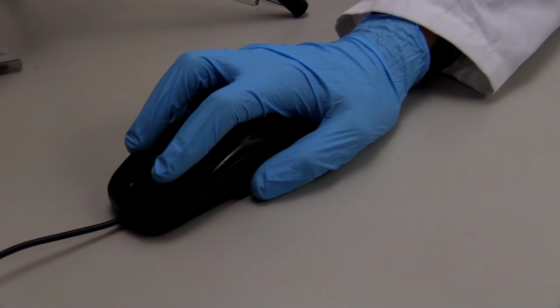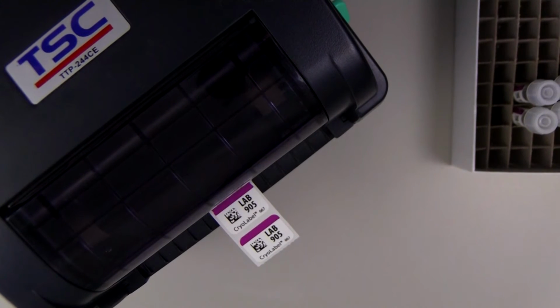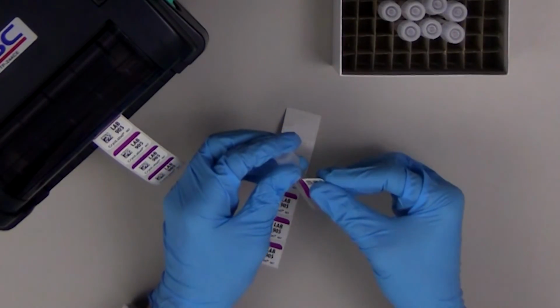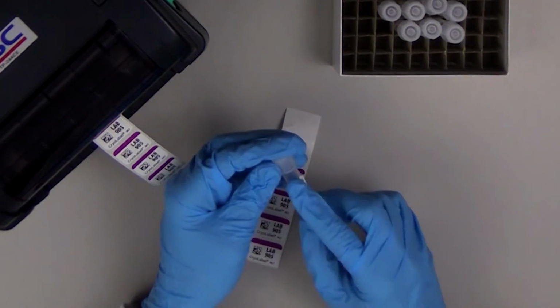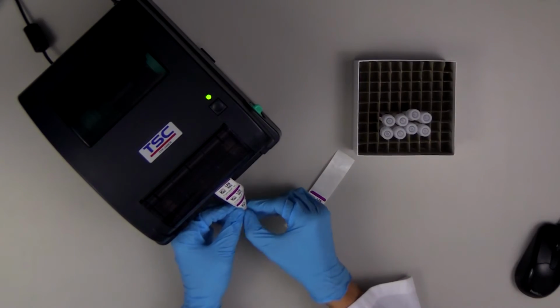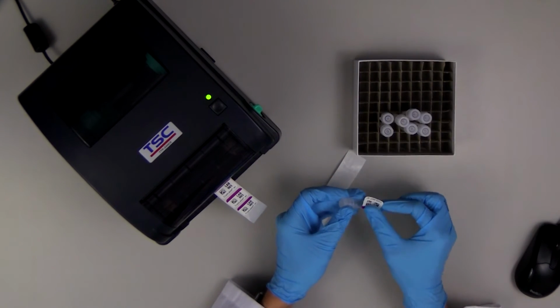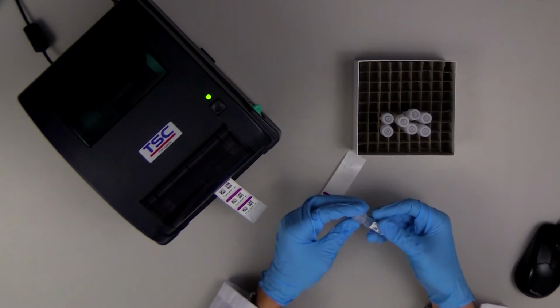All right, I'll use this new printer that just came in. Probably gonna give me nothing but headaches. Mm-hmm, these are pretty cool. They got colors on them, barcodes go right into our system, 100% accuracy, and they stick to cryogenic surfaces. It's pretty cool. You know, I gotta say, this is one of the better ideas you've had.